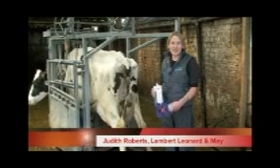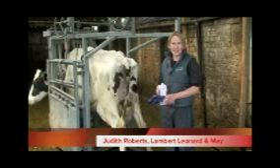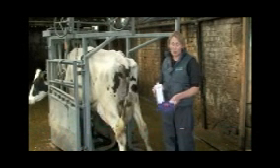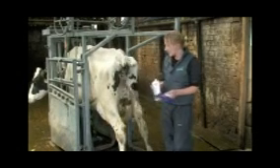We're going to perform a California Mastitis Test on this cow. That's going to test her to see if she's got subclinical mastitis, and it'll look for any quarters that are about 400,000 or more in terms of cell count, so it's useful in herds that don't milk record.